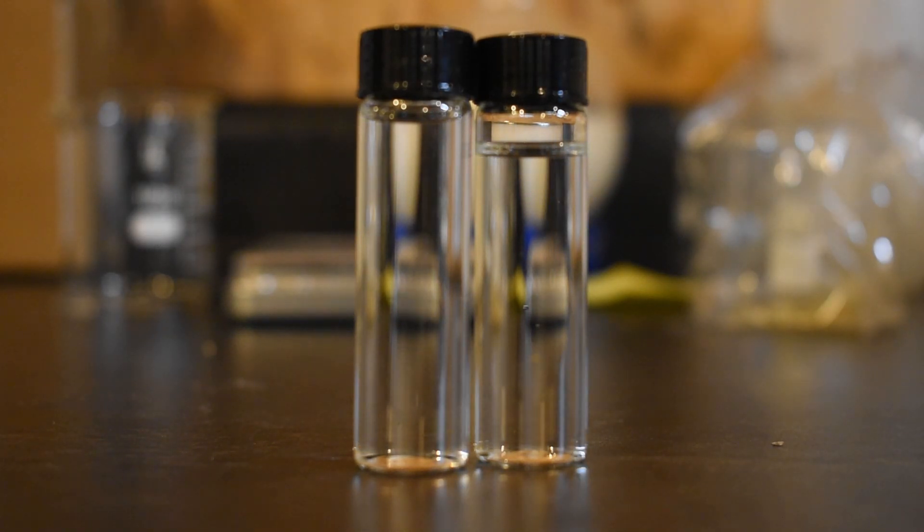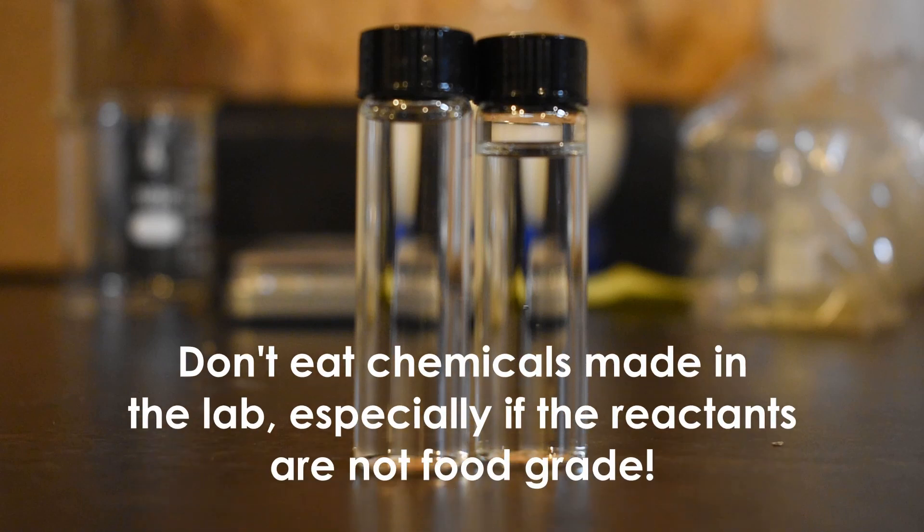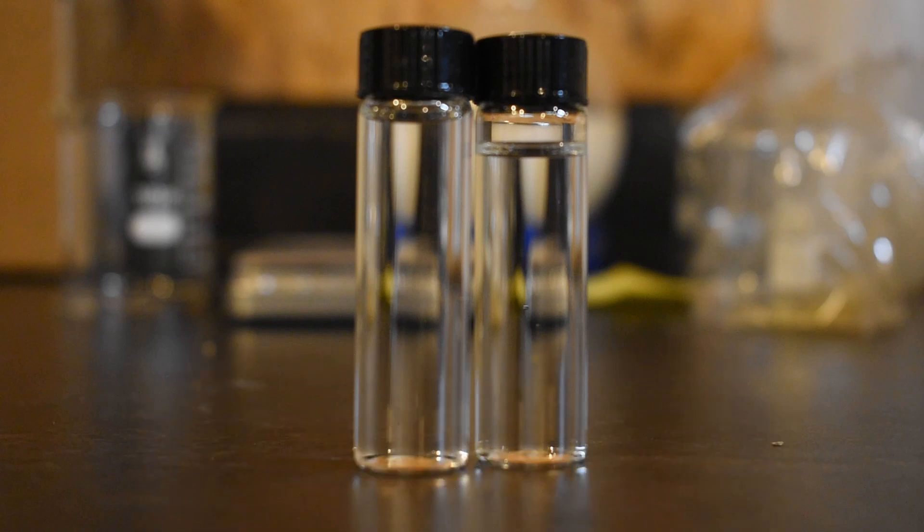In any case, this was enough isoamyl acetate to fill up two whole vials, and that's more than enough for me. I'm not going to be using this for flavoring anything either, I just like the smell of it, so this is a totally cool outcome for me.